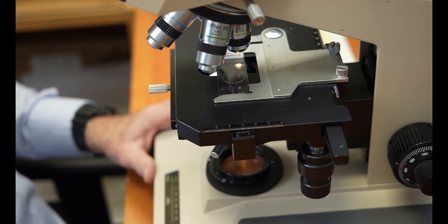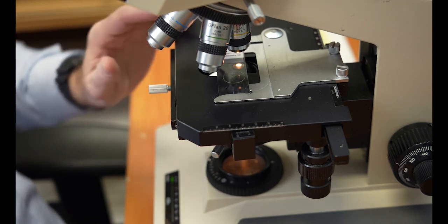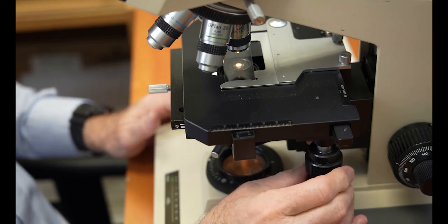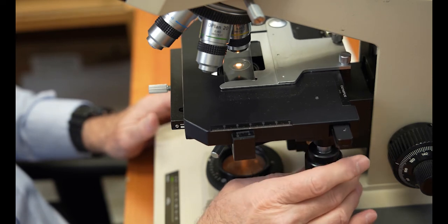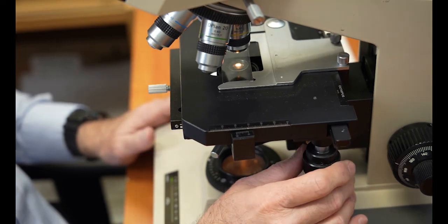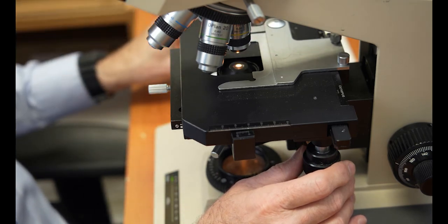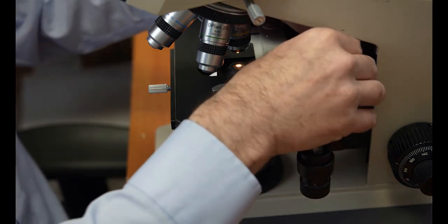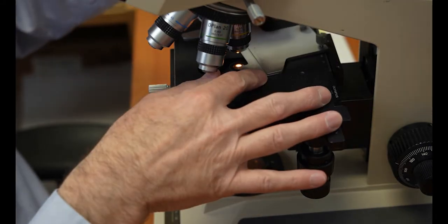Here we have a biological microscope with a mechanical stage on it. First thing after putting your slide into the mechanical stage is now you've got to move your mechanical stage to get the slide to where you want to start viewing things. And you only have an X or Y view here in order to view things. So we're going to remove the slide, set it aside. We're going to remove the 2 screws for the mechanical stage. They just come right off.